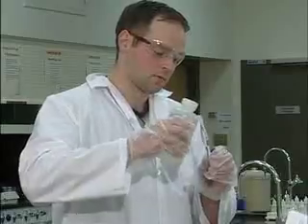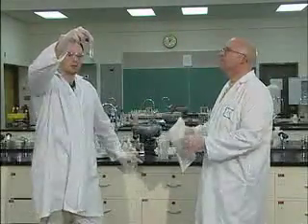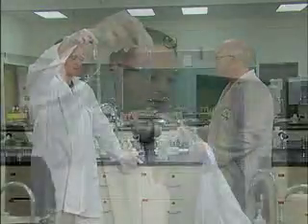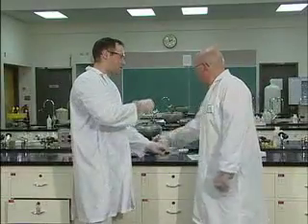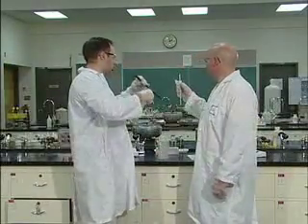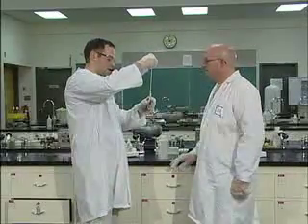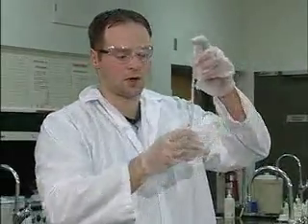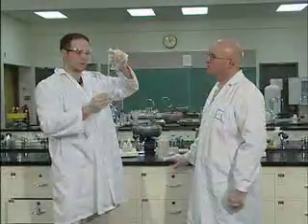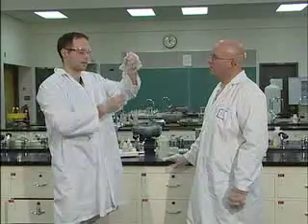So what you're going to do is fill this about 3/4 full, and to me, 3/4 full is just below the white line. That's just water. Now you're going to put your thermometer into the test tube. You'll notice it gets very close to coming out the top. You don't want to break that. Put your thermometer in there for a couple of minutes to read the temperature of your water.